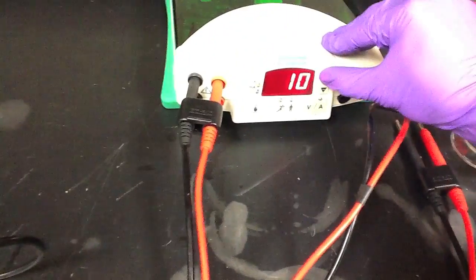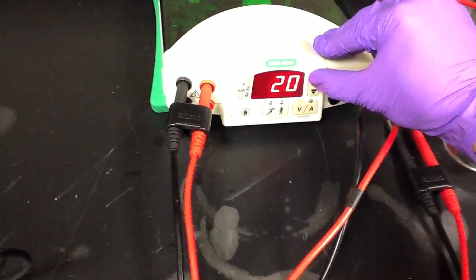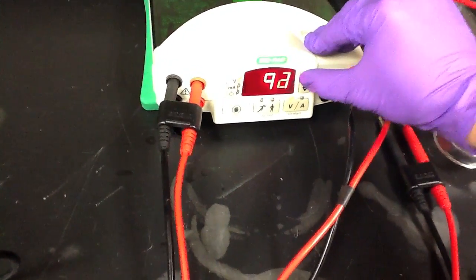At this point in time, we're now ready to connect our gel to a power source to place an electrical current through it that will move the DNA through the gel.